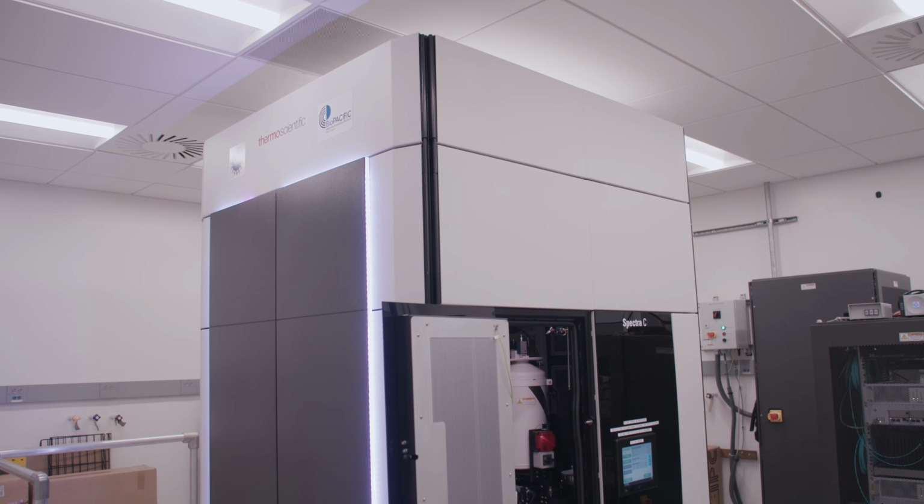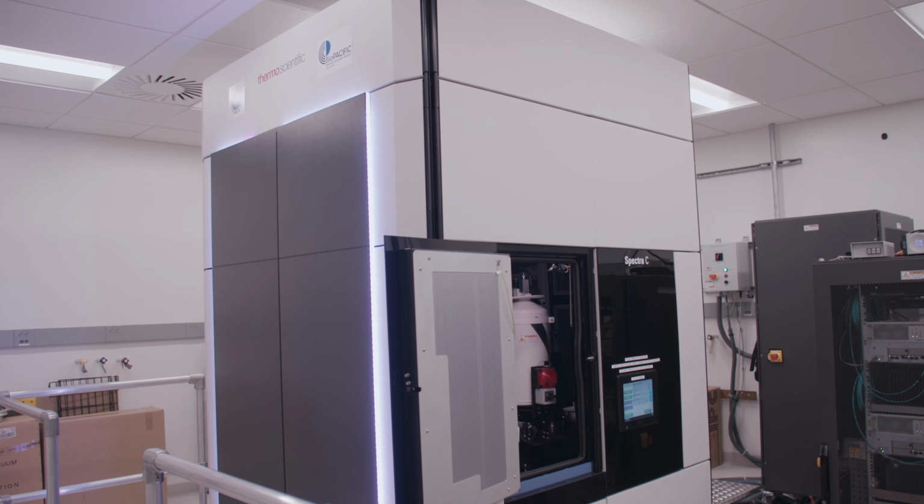What makes this microscope special for BioPACIFIC is the speed at which it can acquire electron crystallographic data. Using microED, we can take data as quickly as on an X-ray diffraction tool and faster than time-limited synchrotrons. Using the software automation tools in electron microscopy, we can take data from hundreds of crystals. We can use this speed to rapidly screen samples and acquire high-precision structure solutions.